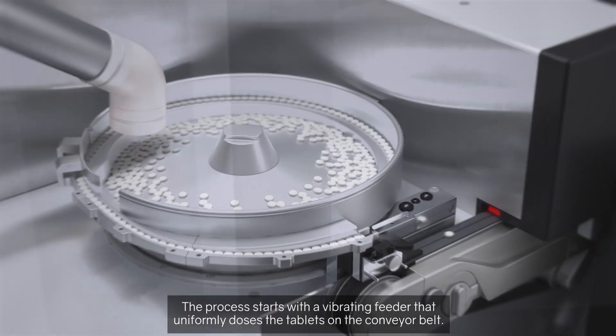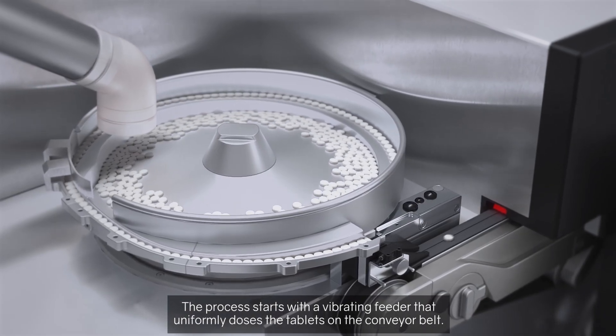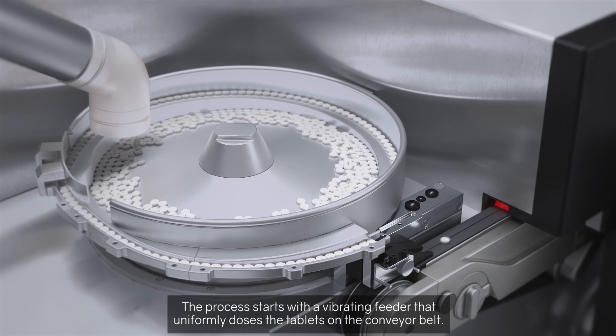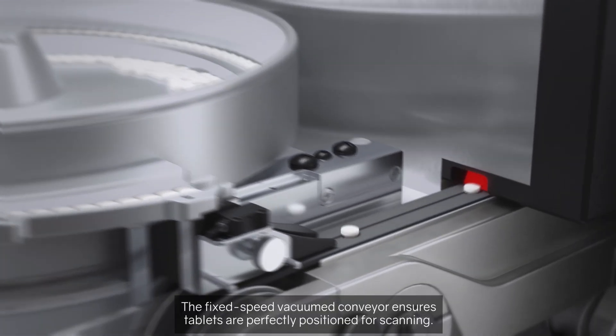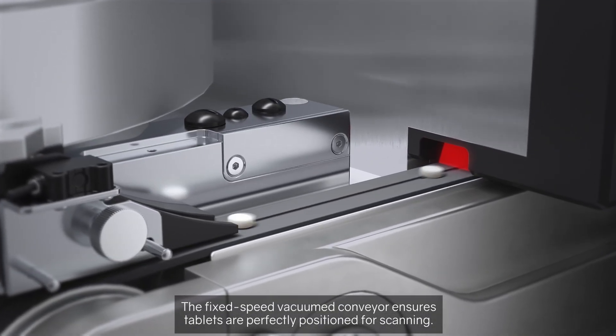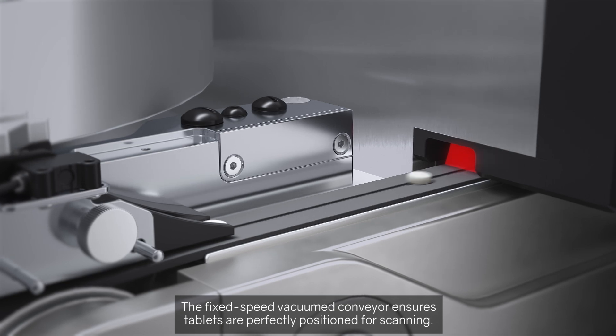The process starts with a vibrating feeder that uniformly doses the tablets on the conveyor belt. The fixed-speed vacuum conveyor ensures tablets are perfectly positioned for scanning.